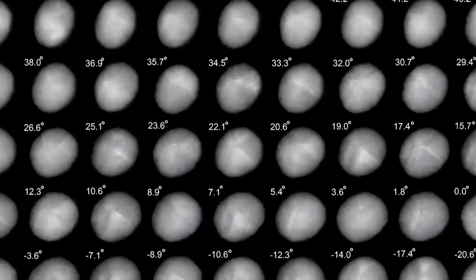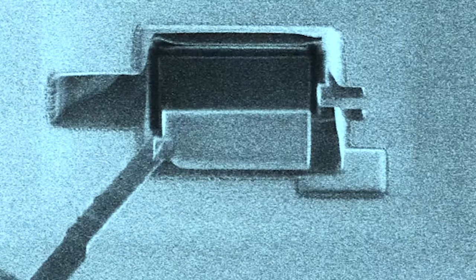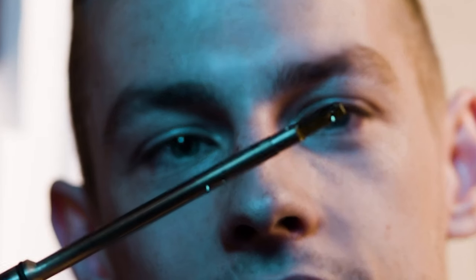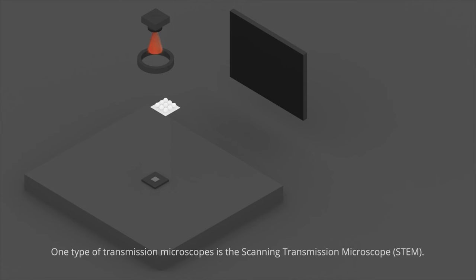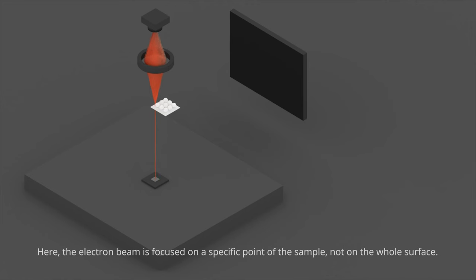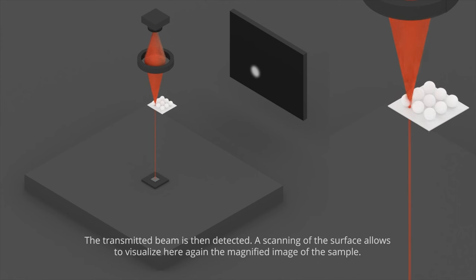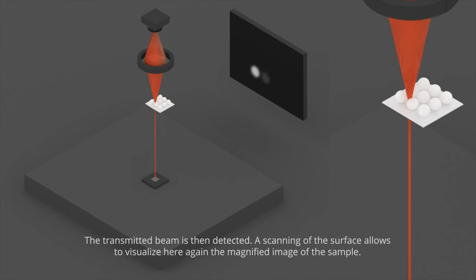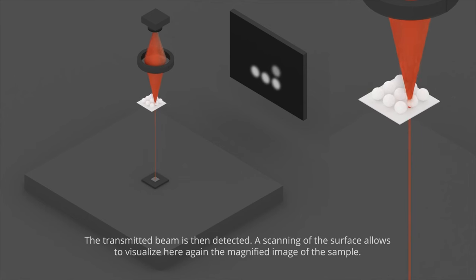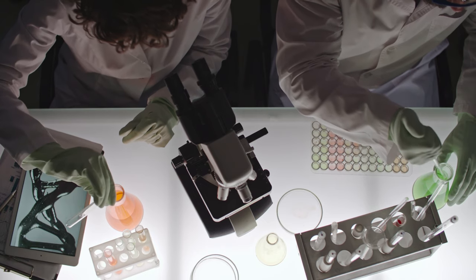If it weren't for these pillars, any image would become blurred if someone at the other end of the building slammed a door. The difference from SEM is that TEM has a much higher resolution, due to the peculiarity of the sample itself and the electron beam. If SEM registers new electrons that flew out of the sample under the influence of the electron beam, then in TEM we observe the original electron beam change as it passes through the sample. Electrons flying through the sample interact with atoms of the material and change, and after they get into the detector, it tells us exactly how the original beam changed.